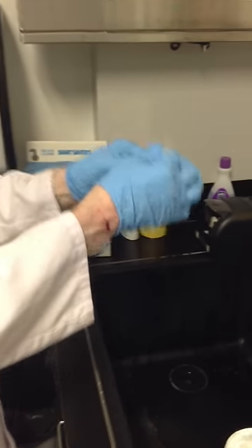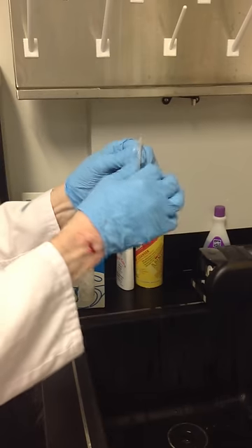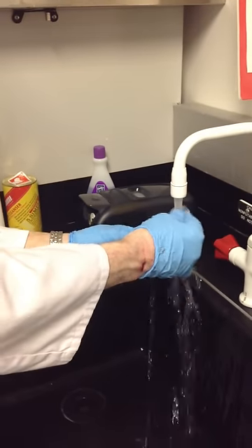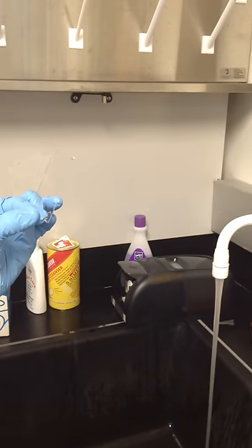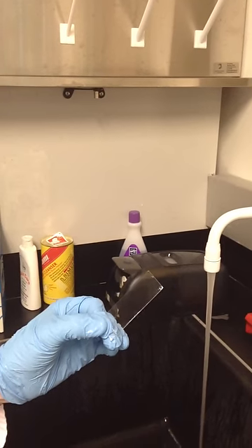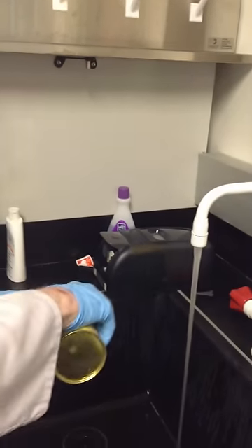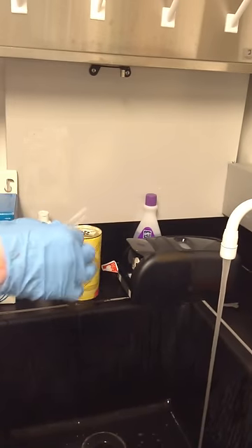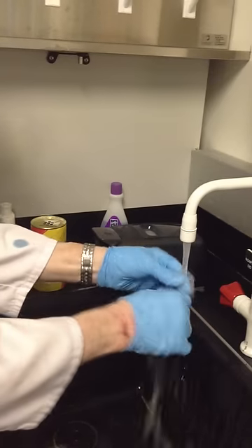The thicker you make the paste, the quicker it will wash off. Then you rinse it and make sure you get all the soap off. To test it, hold it under the water — if it withdraws like this, it is dirty. If it's dirty, you've got to wash it again. It usually takes two times to get it good and clean.